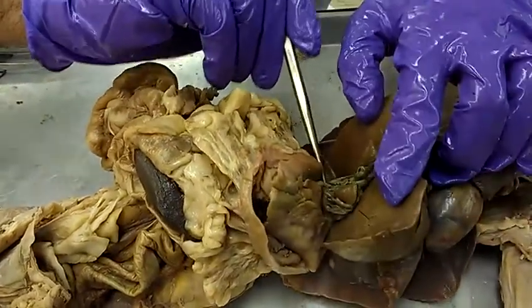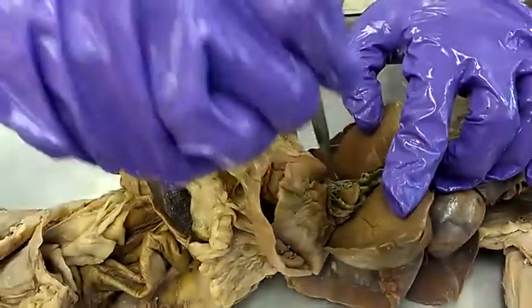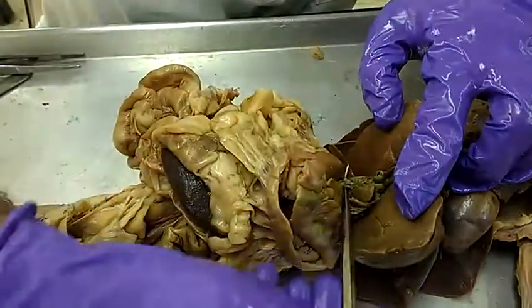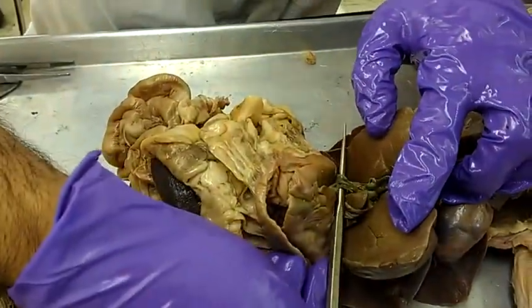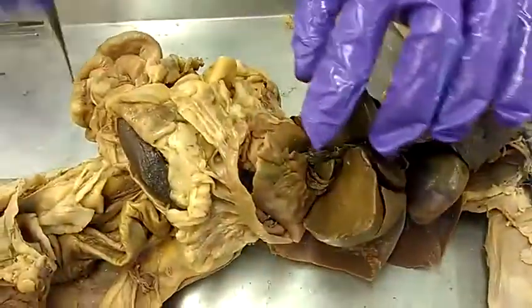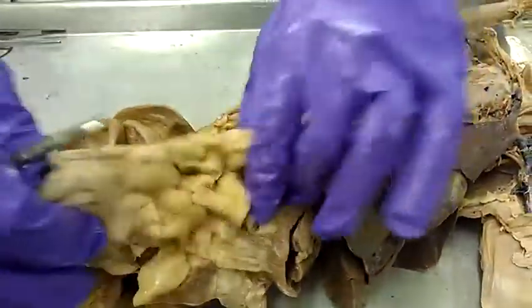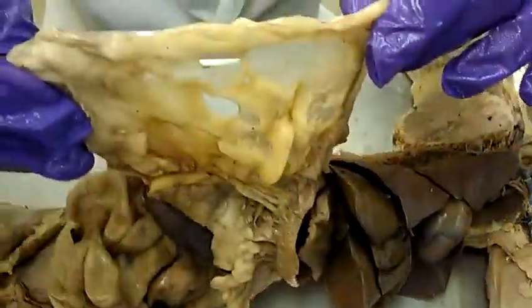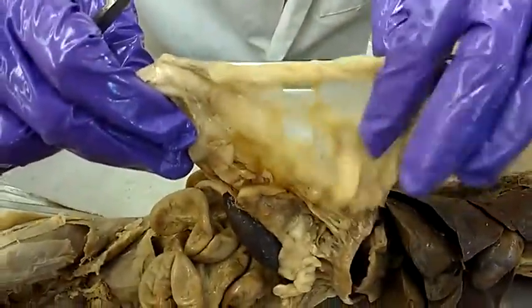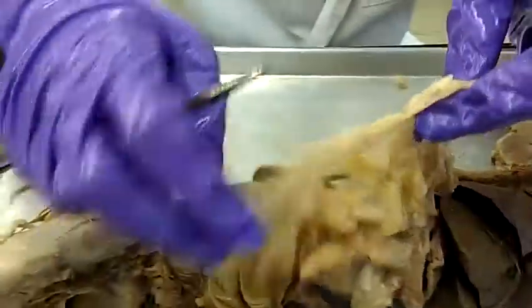That is the common bile duct. All right. Common bile duct. The greater omentum — greater omentum.